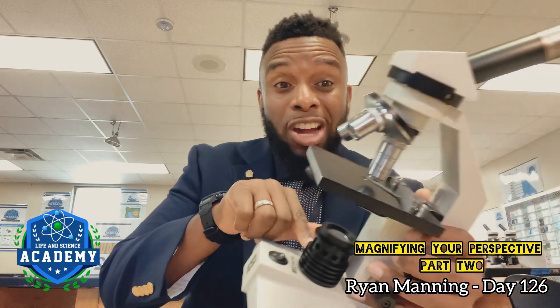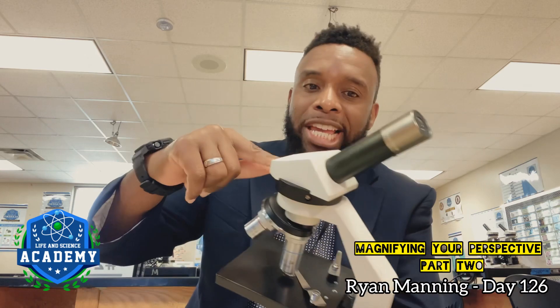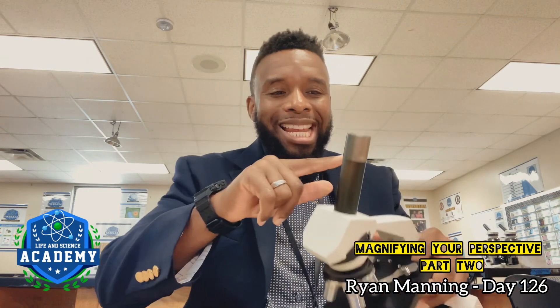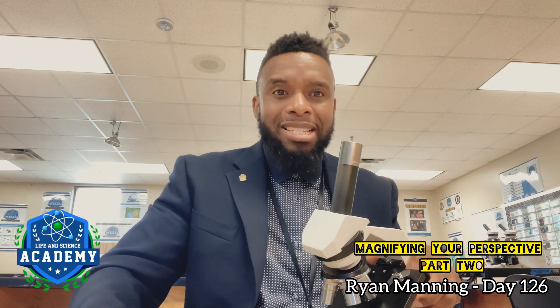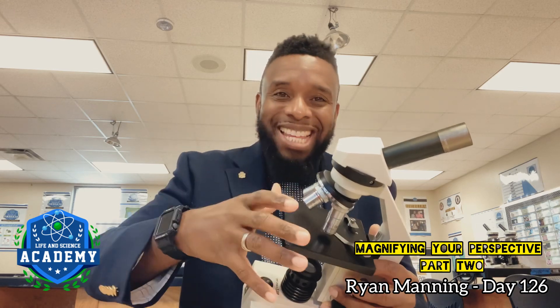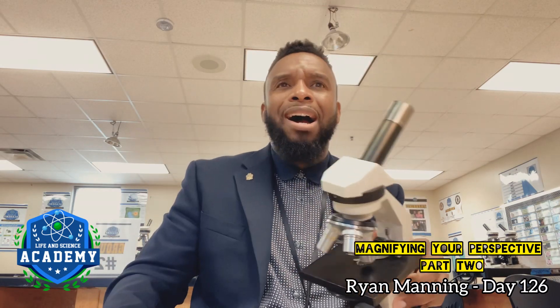I turn on my light — the light goes through this black portion called the stage, into the objective, through the body tube, and then into the ocular lens, which is what I'm actually looking through. If we did not have this body tube, it doesn't matter how amazing this ocular lens is. It doesn't matter how amazing we are. It's the body tube that aligns everything. Without it, the light would not be able to travel from the light source through the diaphragm, through the stage, through the objectives, through the body tube to the ocular lens, which leads to our eye.